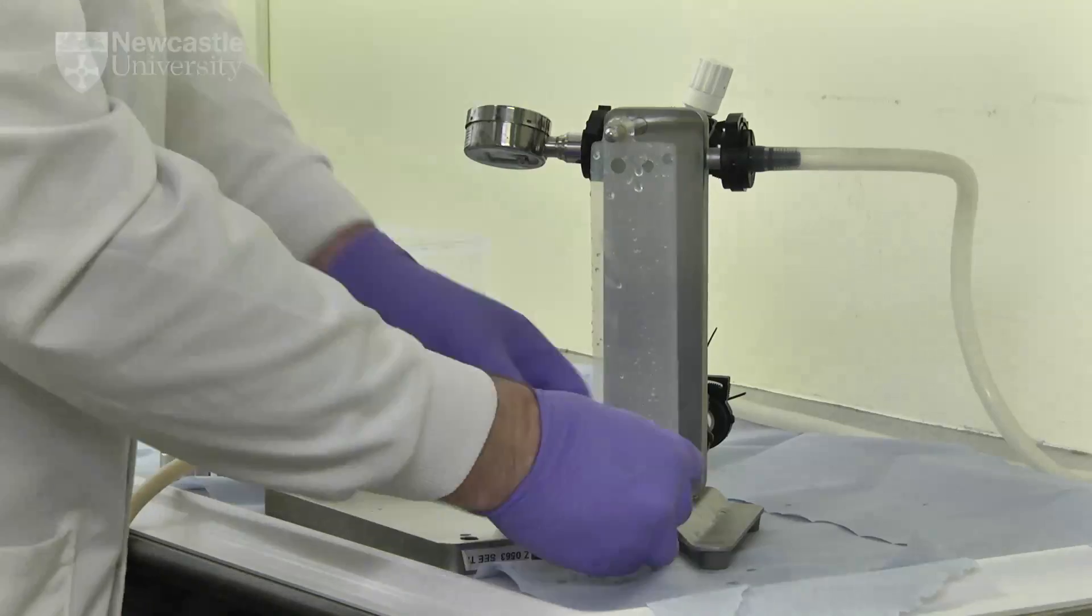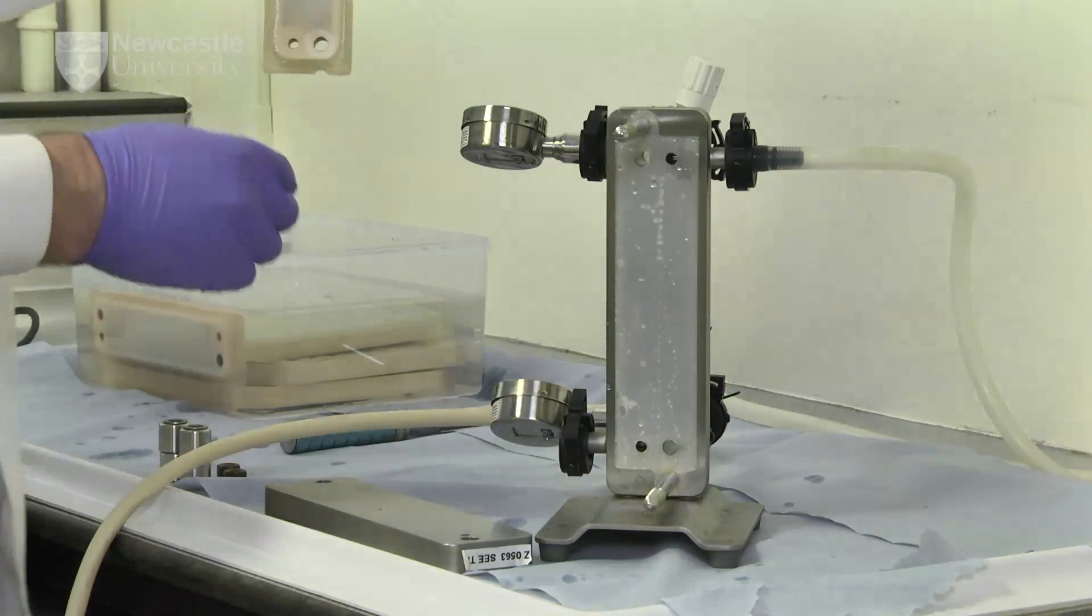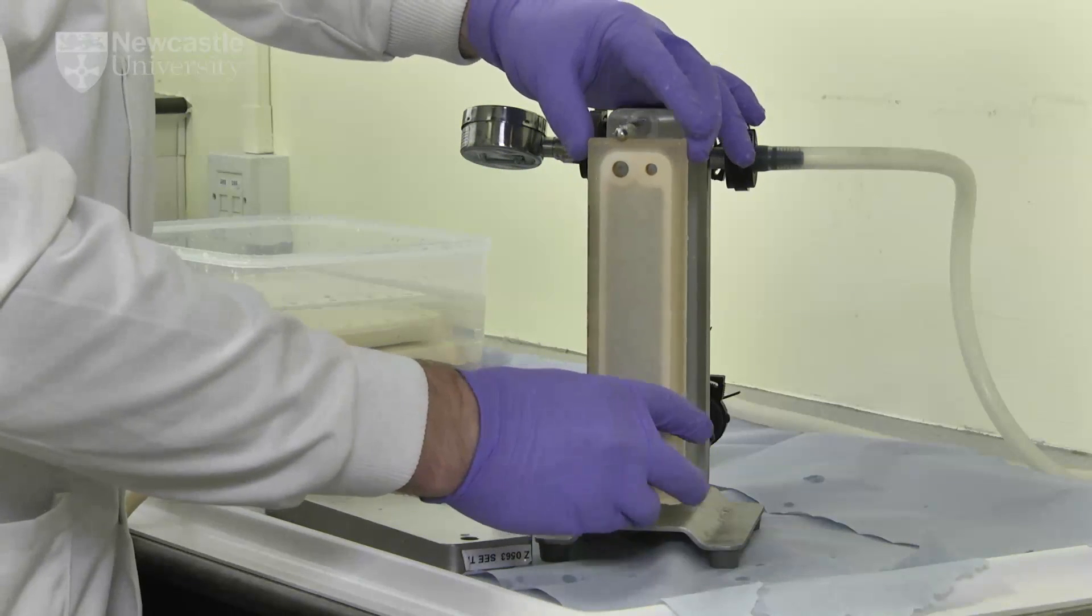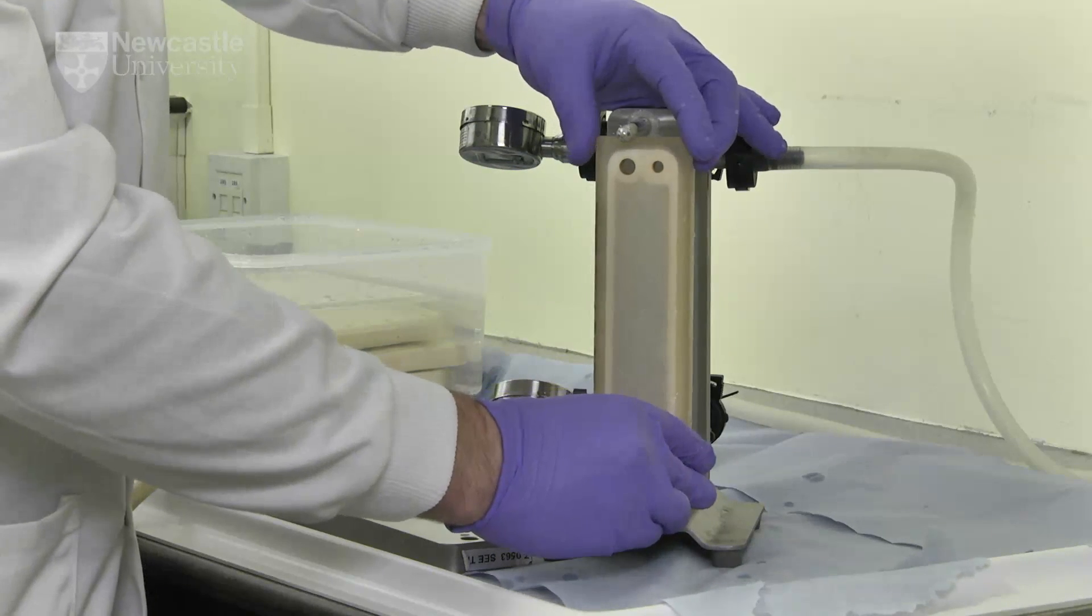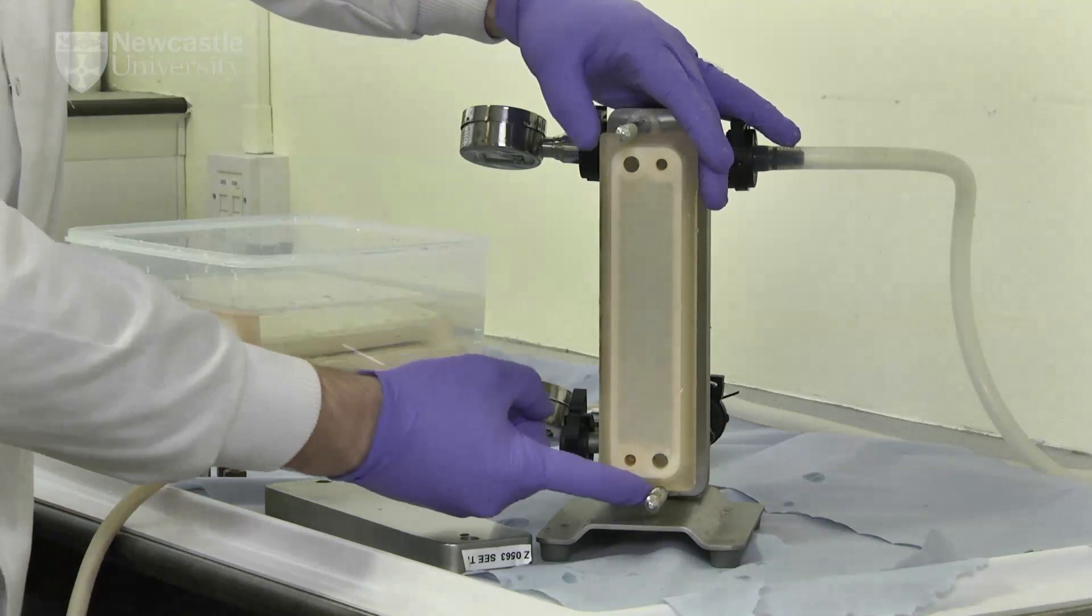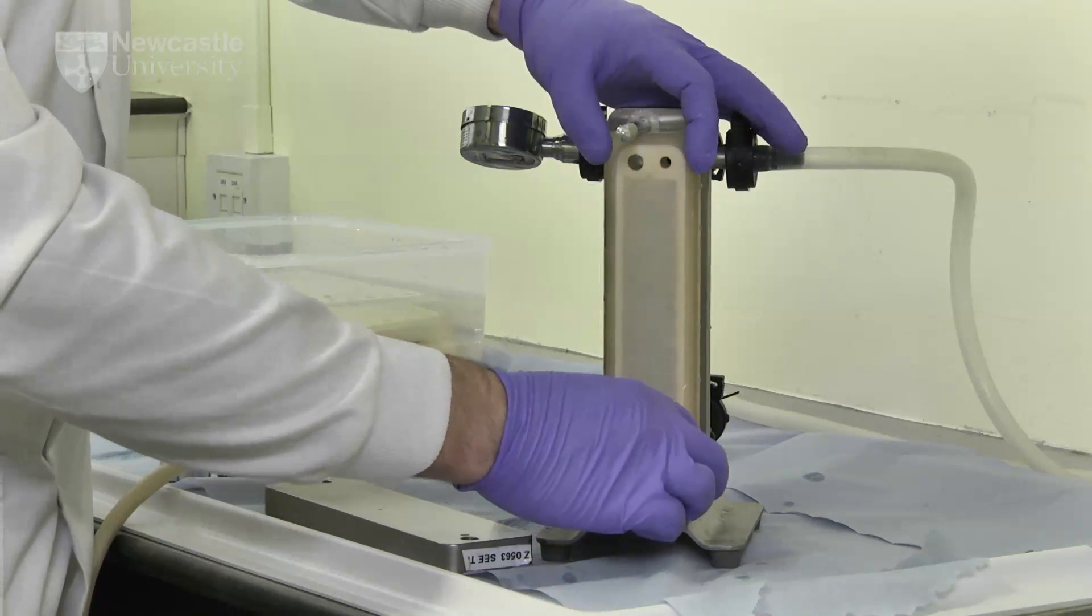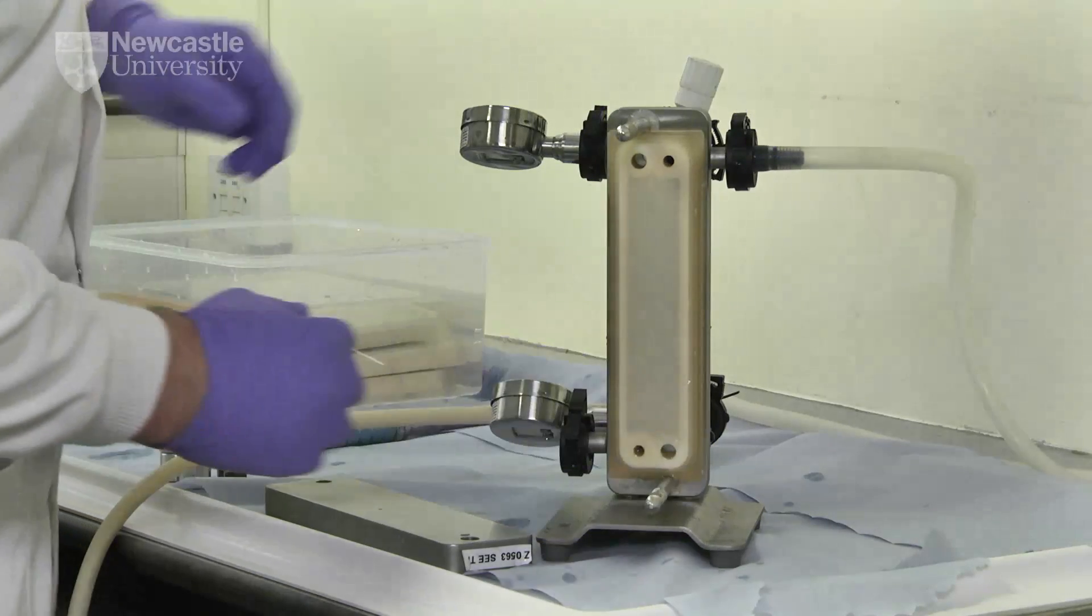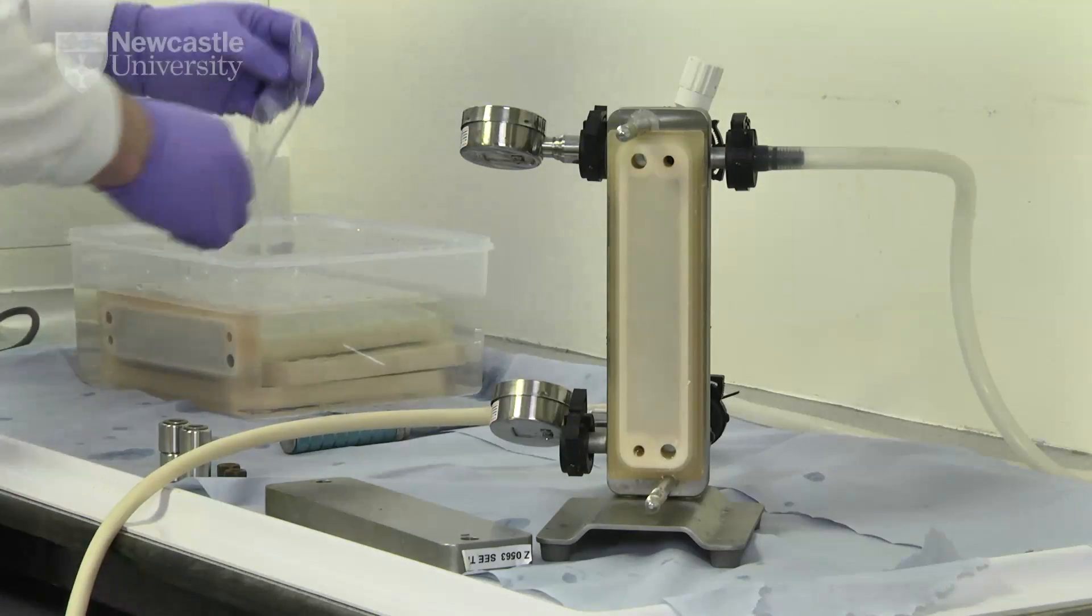Plastic separators may be used as spacers between cassettes. The filtration cassette is fitted to the manifold, aligning the grooves present in the top and bottom of the cassettes with the screw connections on the manifold plate. The feed, retentate and permeate ports in the cassette will line up with the ports in the manifold plate.